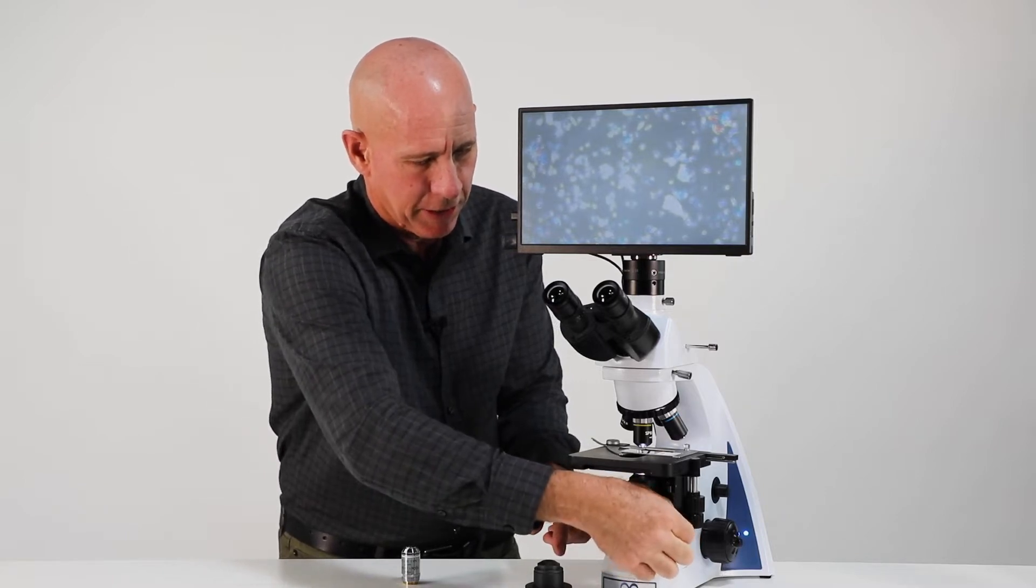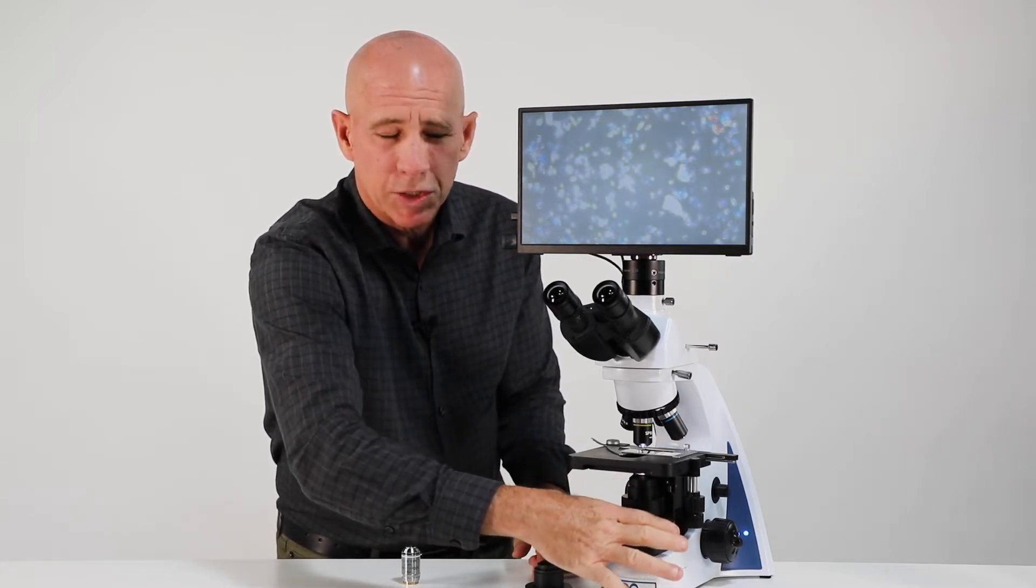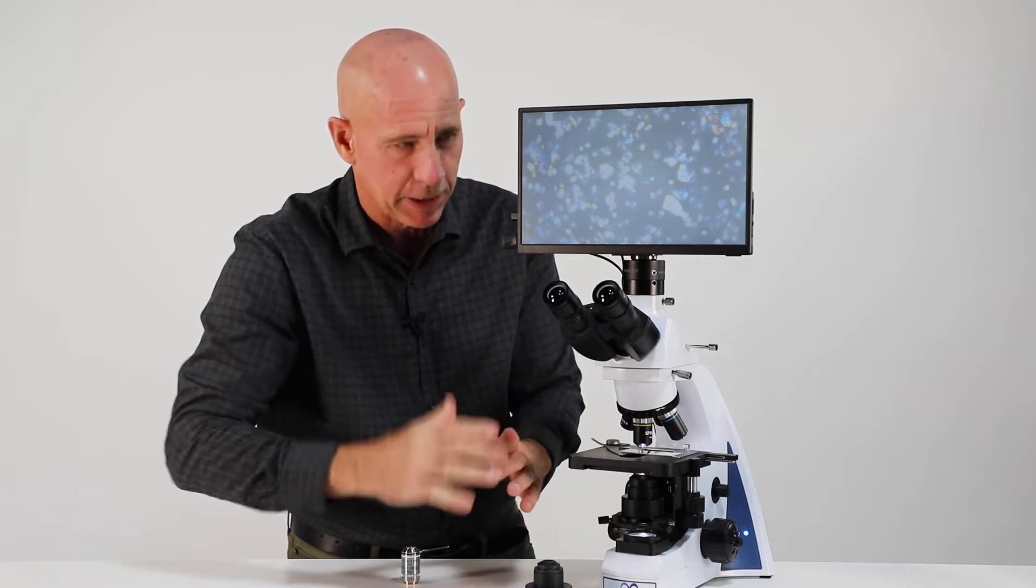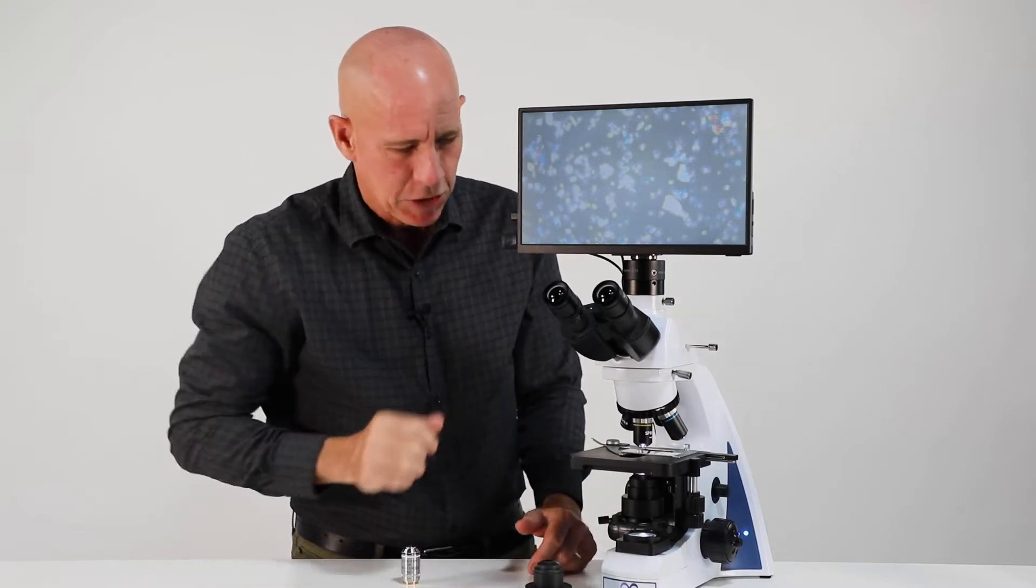Okay, make sure it's snug. Again, we're not going to change our alignment yet. These two angled screws move it around and move your field of light, but don't do that yet.